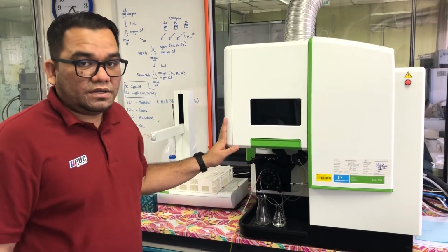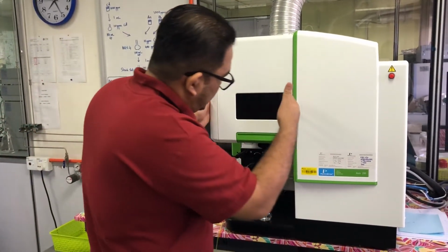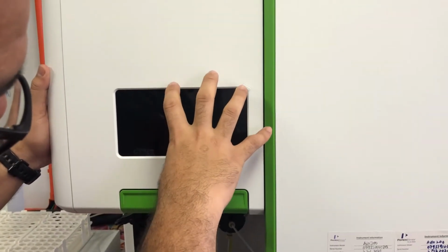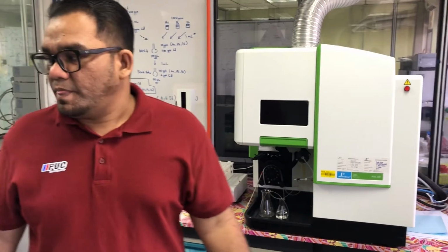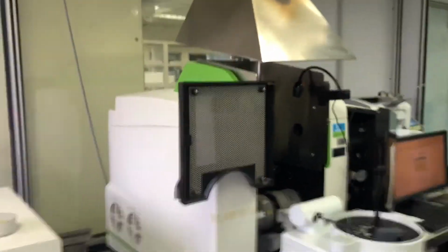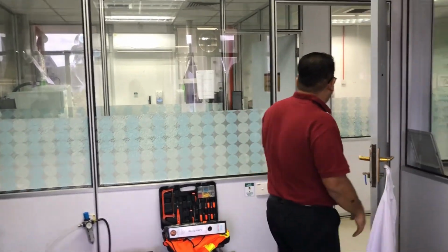So remember, in every instrument we have two parts: the atomizer and the detector. The atomizer is here, the plasma, inductively coupled plasma. We can see the plasma inside here if the instrument is on, right? This is the detector part, which is the optical emission spectrophotometer. We have a similar setup, we have AAS also here; the setup is for graphite furnace. One day when you are here in UTM, I will bring all of you here to see how we analyze a sample using all these instruments. Alright, let's go.